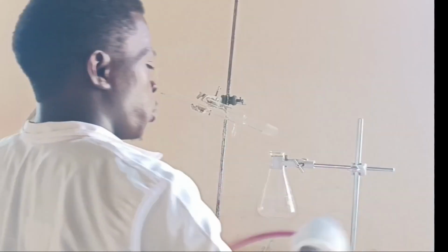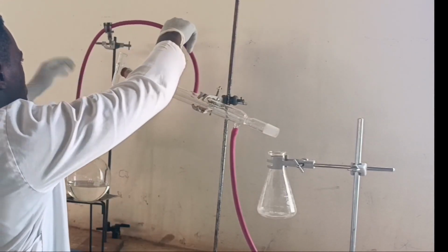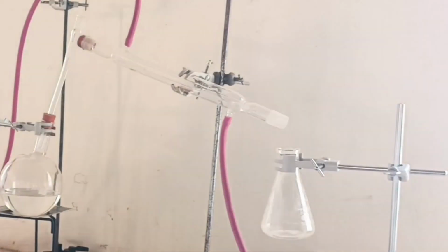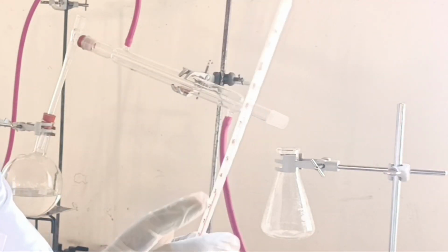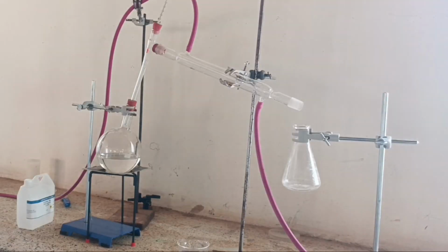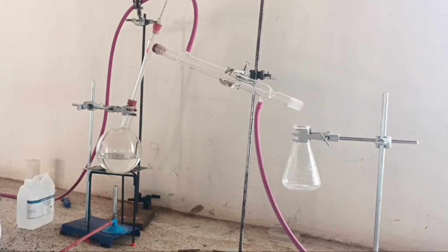As we are setting up our apparatus for this experiment, let us discuss what fractional distillation is. Fractional distillation is the method used to separate a liquid from a uniform mixture of two or more liquids but of different boiling points. One of the ways to check the purity of the separated liquids is to measure their boiling points, e.g., pure ethanol boils at 78 degrees Celsius. But this method has limitations to achieve 100% ethanol. Therefore, a student is advised to identify those limitations.